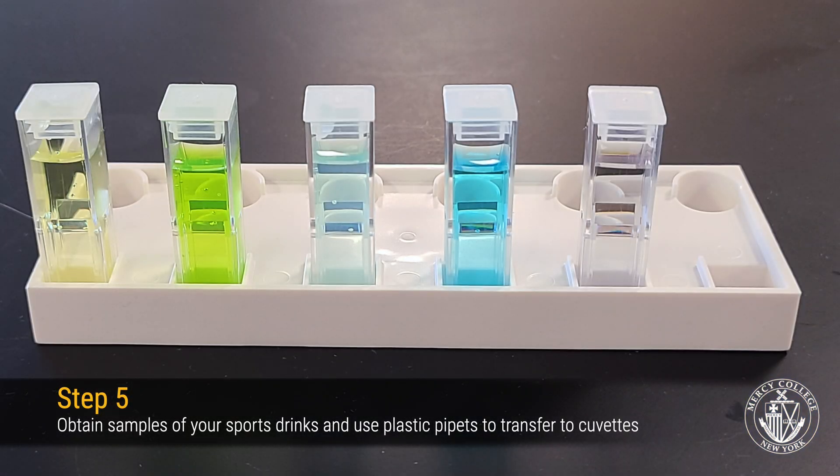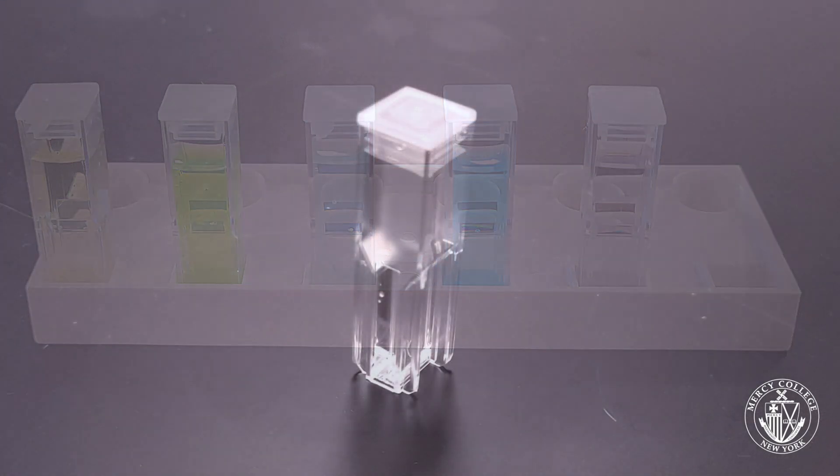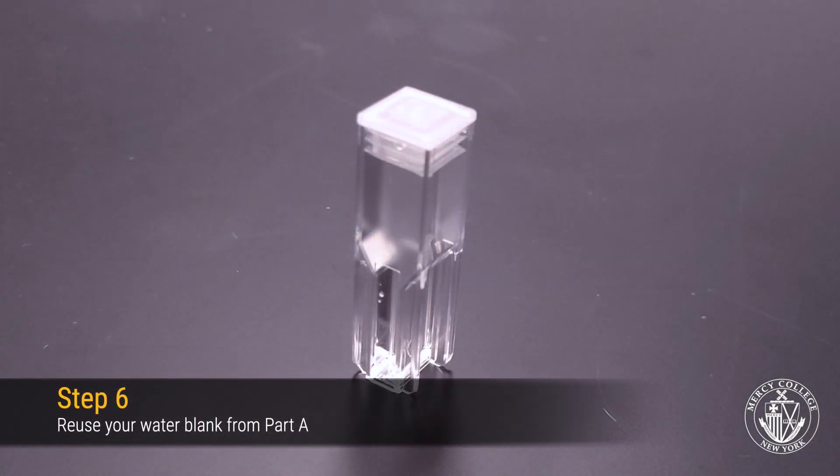Next, select 3 sports drink samples to analyze from the samples that have been provided. You'll also need your water blank from Part A.